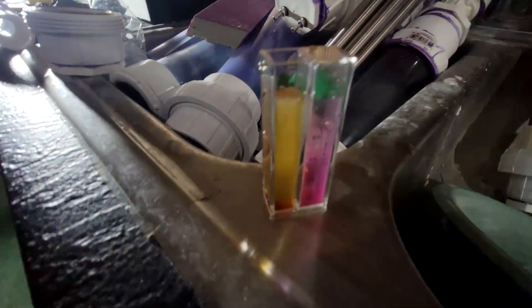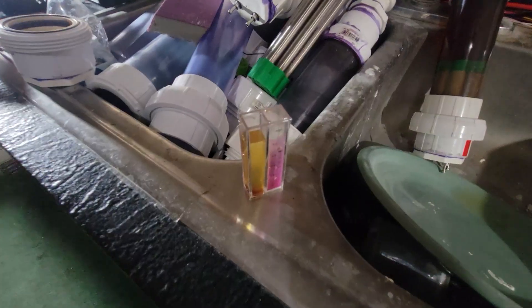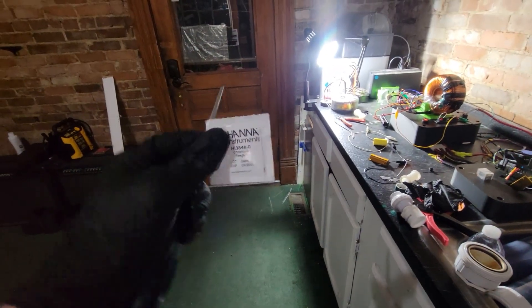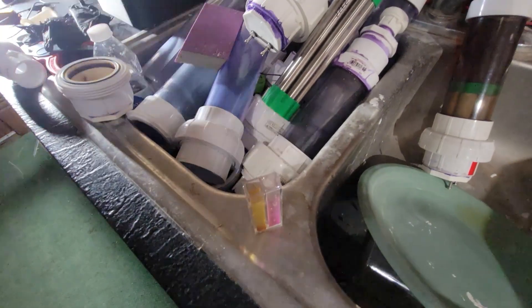Safety first, and do not try this at home. This test is only for experienced home inventors. We have filled the test capsule. For the next part, we are taking you outside to cut this and fill the container with our test solution. We'll be right back.